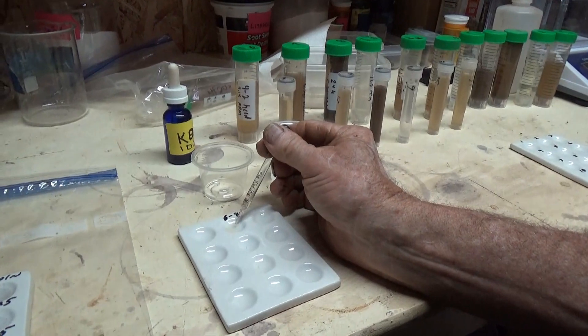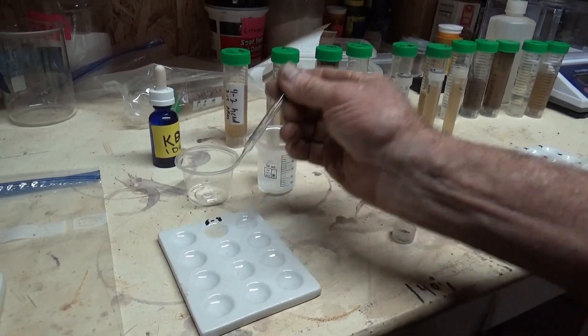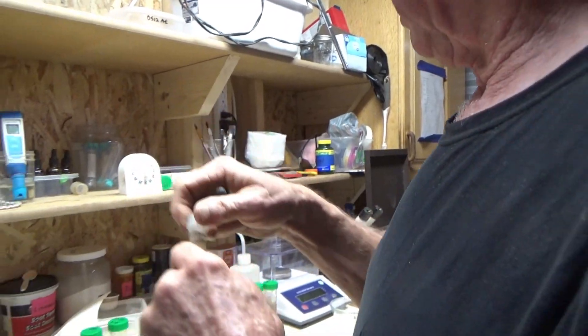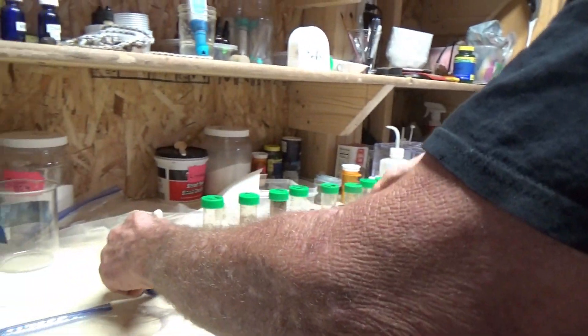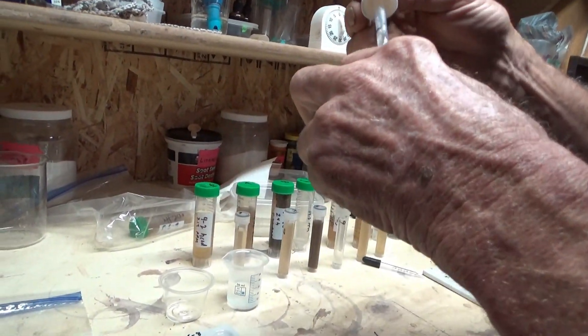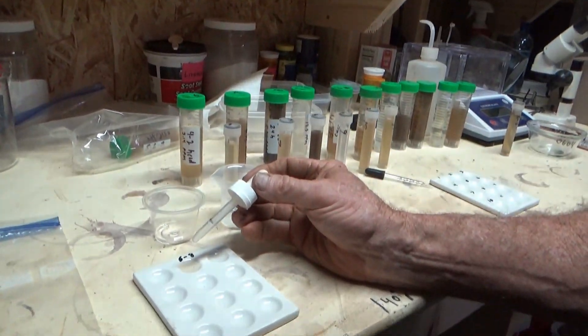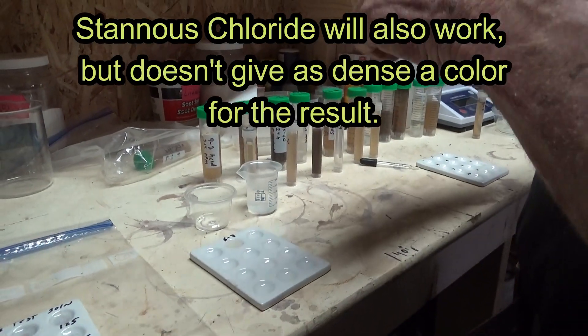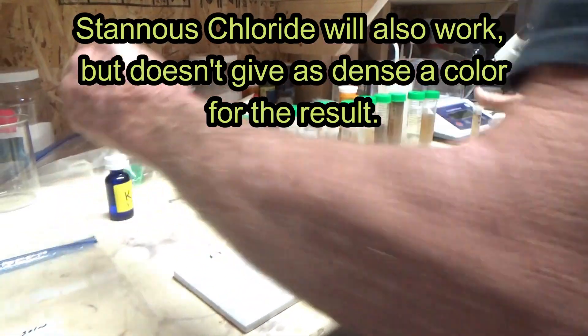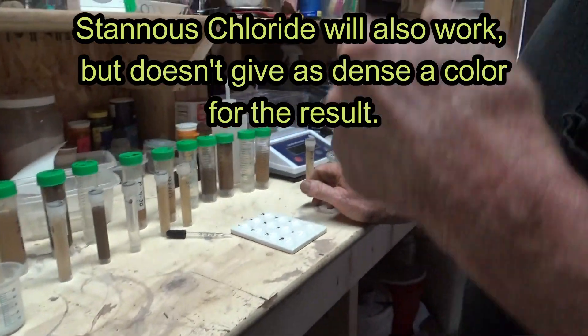You just put the sample in. Of course, there's going to be a little problem - there's floating organics on it. And then you would just take one drop of this and let it evaporate. That's basically all you do.